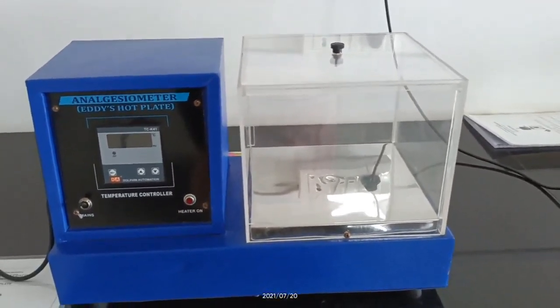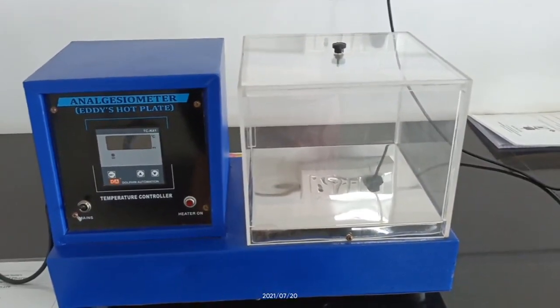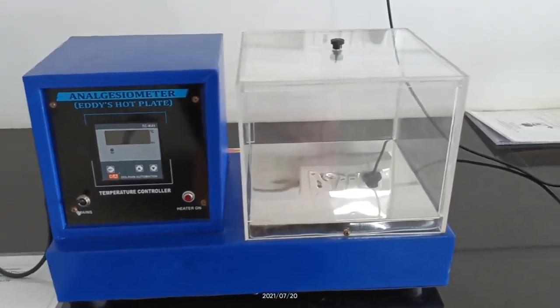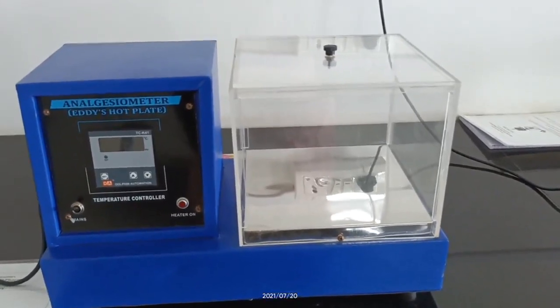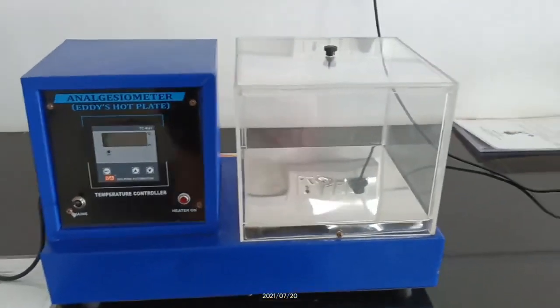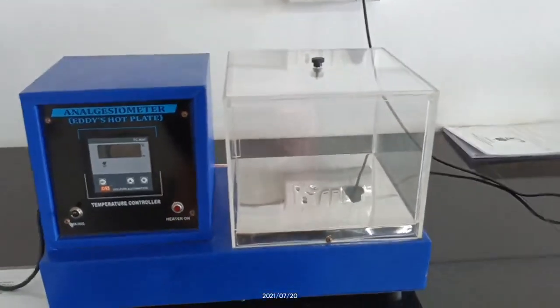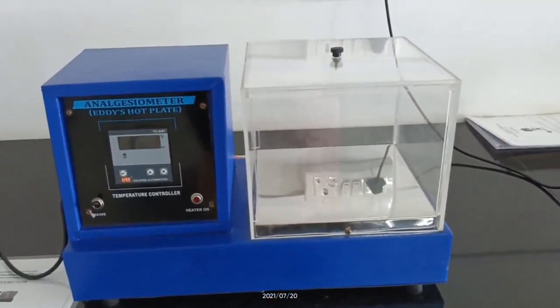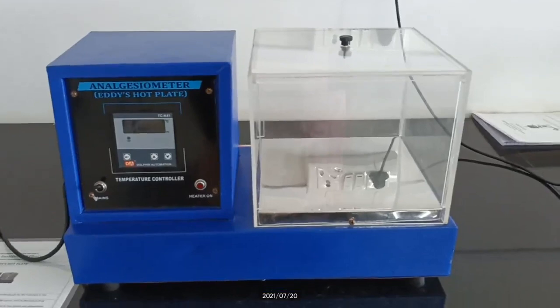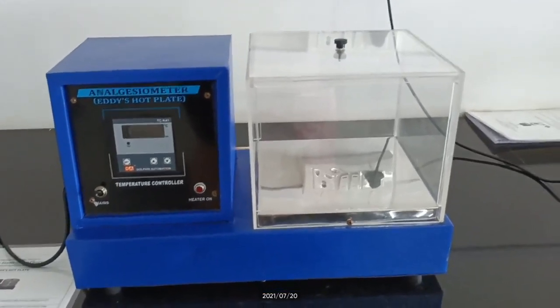Before starting the discussion about this instrument, I want to clarify some basic terms related to it. First you have to know what is pain, what are analgesics. You have already studied these points in the pharmacological theory syllabus.